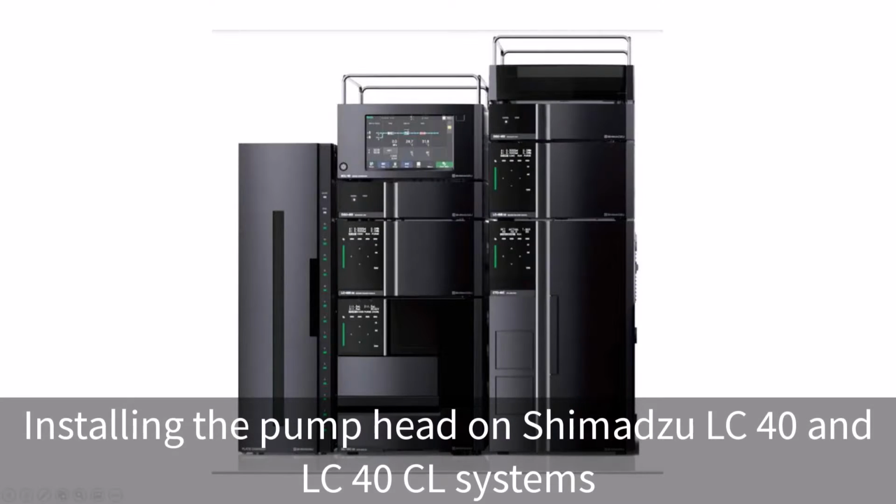In this video, we'll show you how to install the pump head on Shimadzu LC-40 and LC-40 CL systems. The pump head installation may vary slightly depending on the pump model. Please consult the appropriate instruction manual for details.